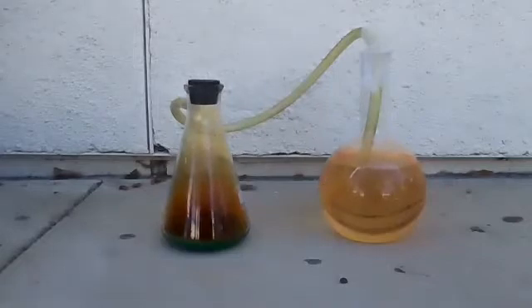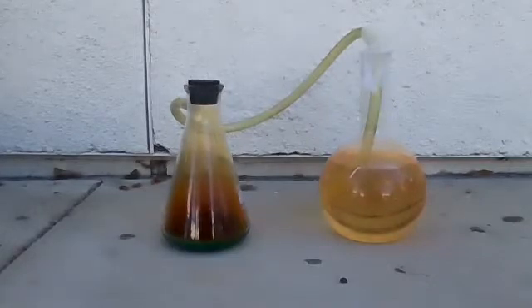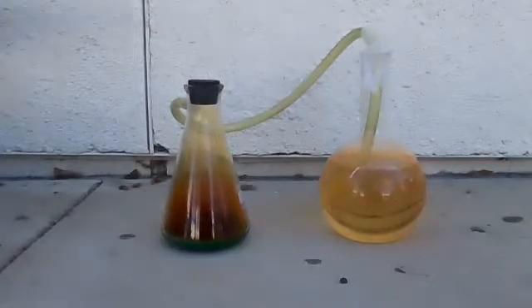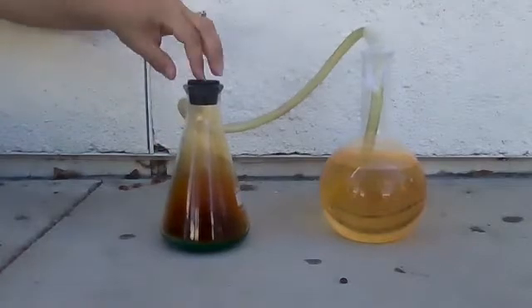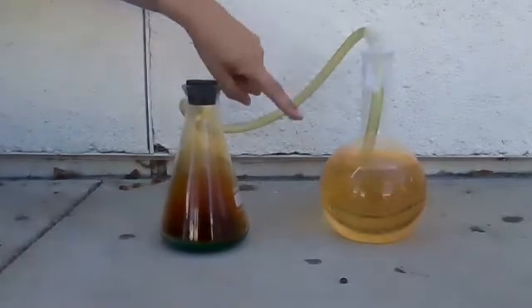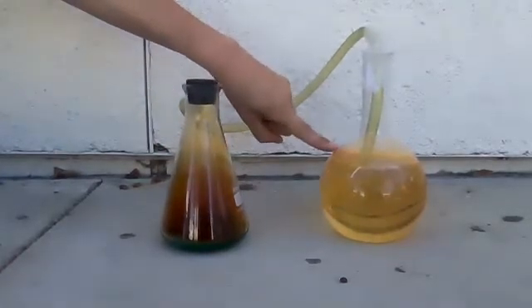...and combine it with the oxygen in the air to make NO2. That's why it's so easy to produce NO2. Okay, what's going on over here in this flask?